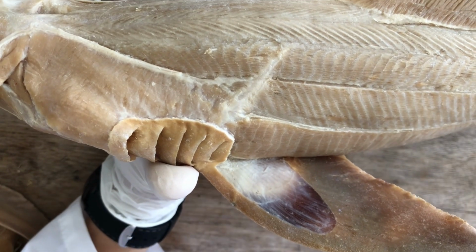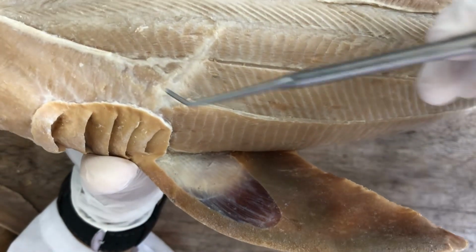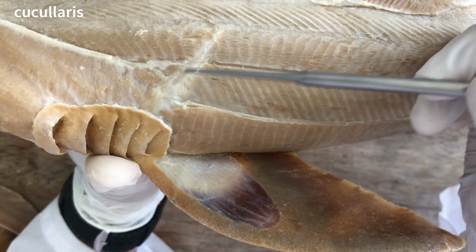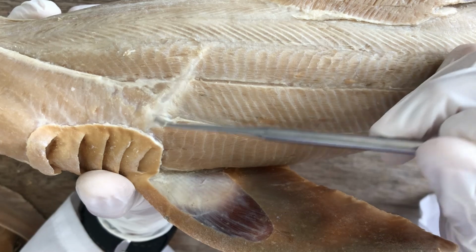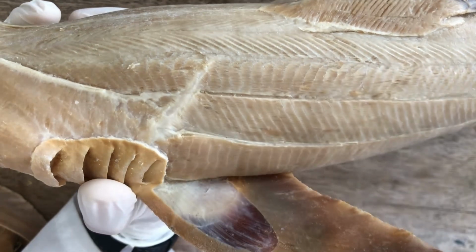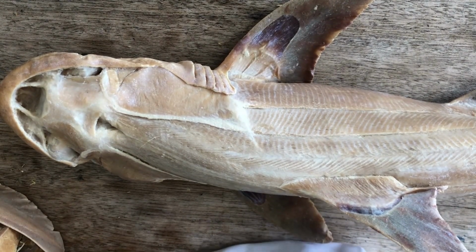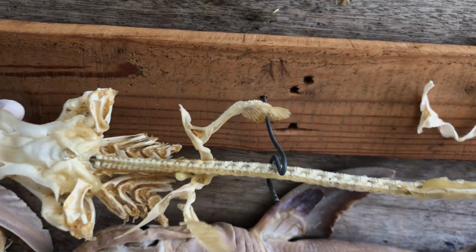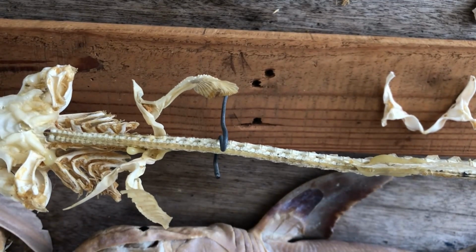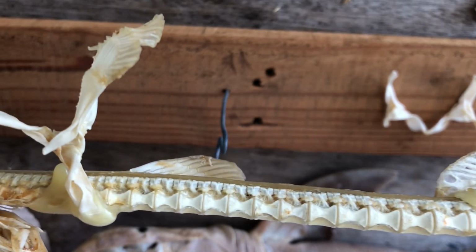And the rest of the levator muscles, levators 3 to 6, are fused into a single structure near the pectoral girdle. So this would be already your scapular process. Let me pause for a bit and get our specimen for gill arches just to remind you. So this is our skeletal specimen for the shark, and you remember that the pectoral girdle looks like this.